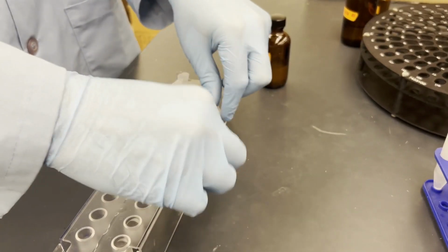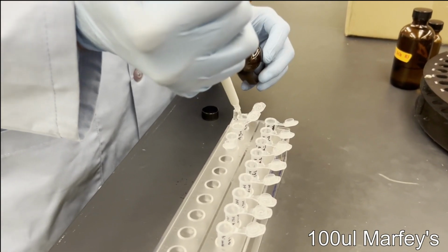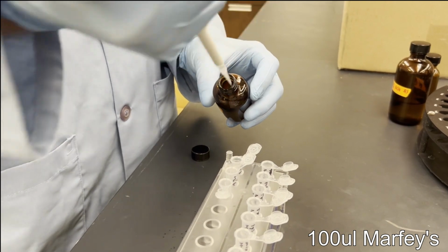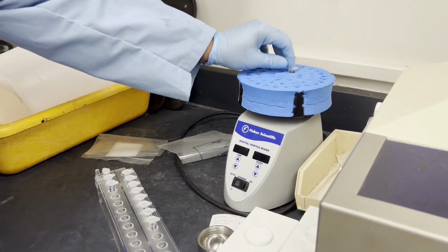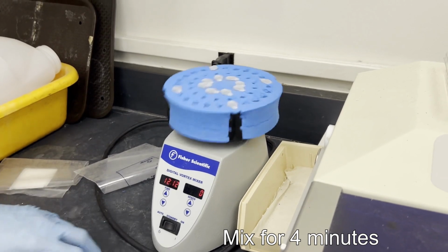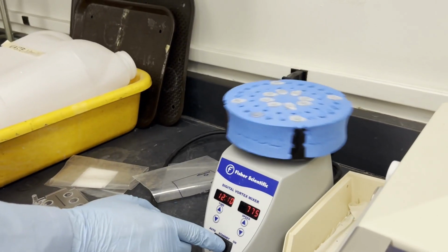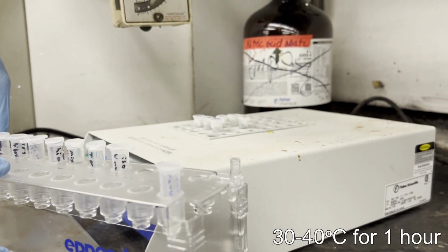With our samples defrosted, we can now aliquot the standards, sodium bicarbonate, and Marfey's, or if they were prepared beforehand, just add the remixed Marfey's. With our Marfey's added, they will need to be mixed at least 4 minutes. A vortexer comes in handy unless you want sore forearms. Once the heating mantle reaches temp and our samples are mixed, place them into the mantle and allow them to cook for 1 hour.